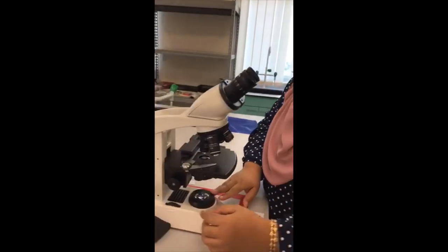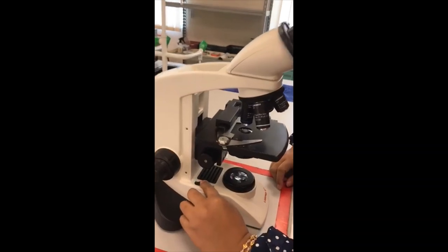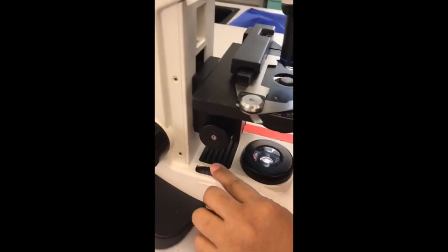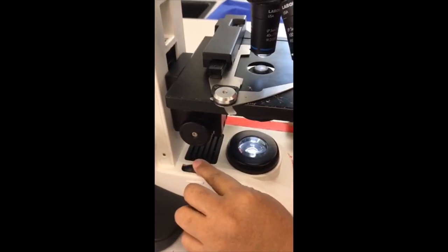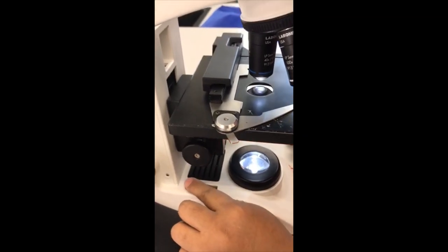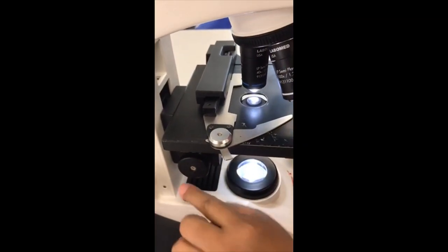Next, I'll make sure the illuminator will emit the light, and the amount of light I can control using this knob.